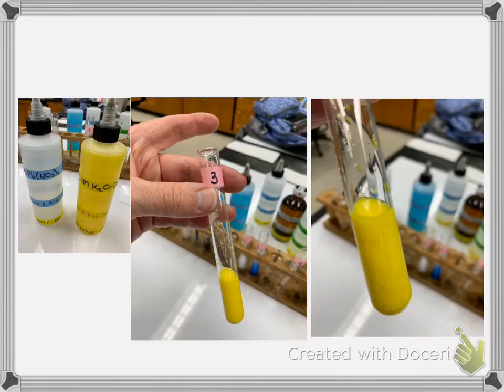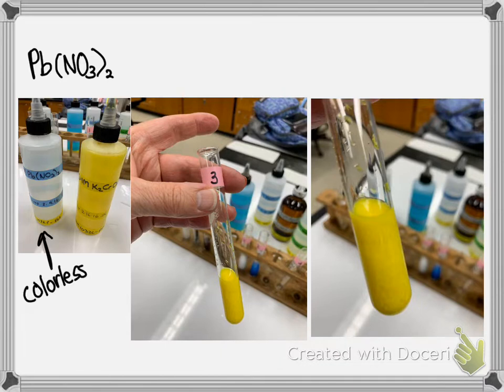The third reaction is lead nitrate, which, this is the lead nitrate, and it was colorless. And then potassium chromate.